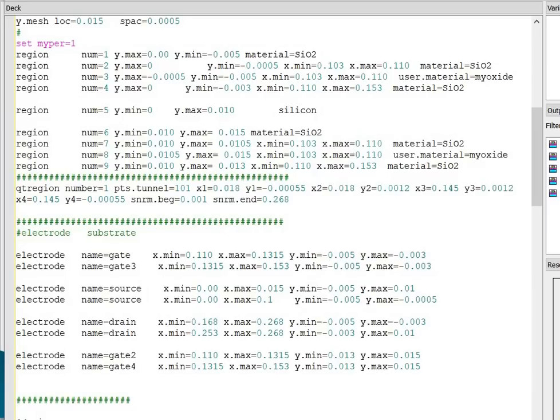Before defining the region or material statement, I have defined the permittivity of the target biomolecule. I have assumed that air is present in the nanocavity region, so I have fixed the value of the permittivity at 1.